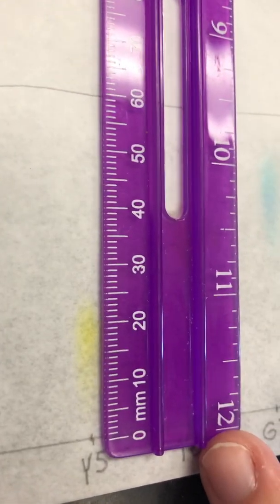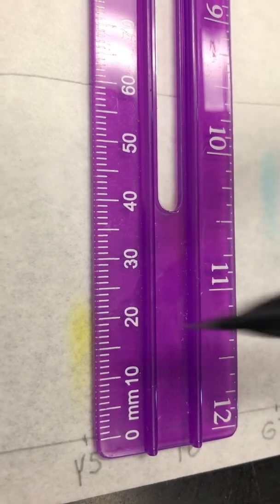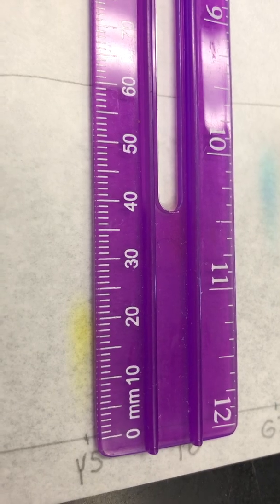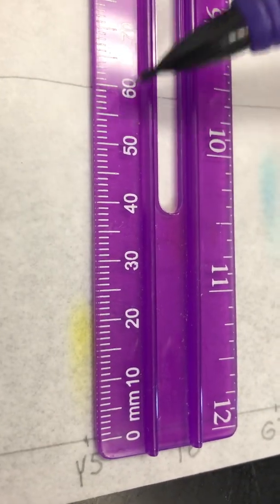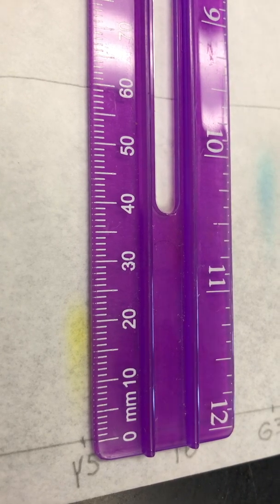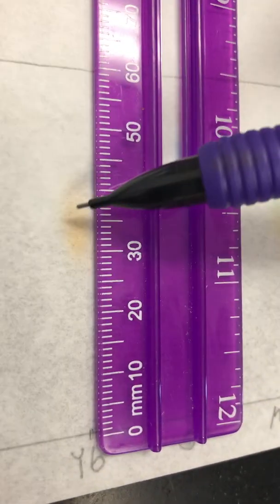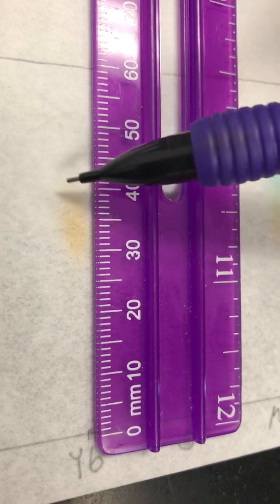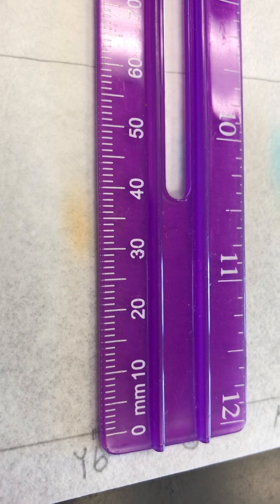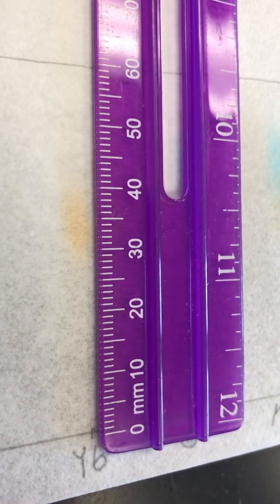All right, yellow 5, here we go. Just right down here, here would be the top of it. Get your D spot. And then go ahead and get your D solvent. All right, yellow 6. Right up here, little guy. I'd say top is probably about right here. So go ahead and get that one. Go ahead and get your solvent spot.